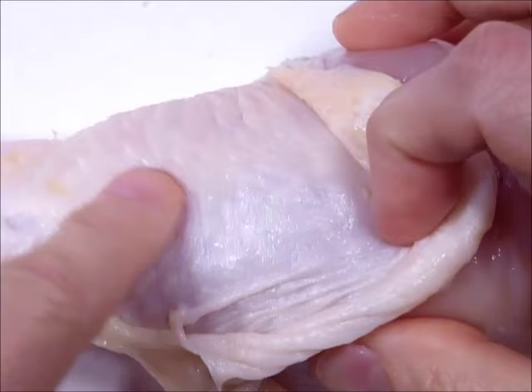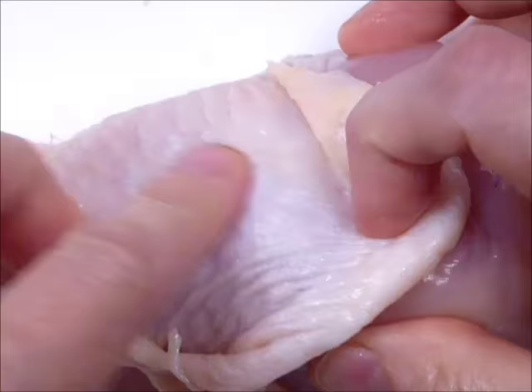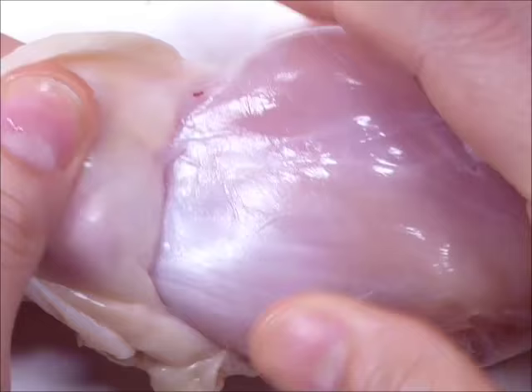This is what keeps the skin attached to the muscles. When you rub your skin, it doesn't slide off — you can feel that it's attached. It's loose enough, but it's attached underneath, and this is how: with this connective tissue.